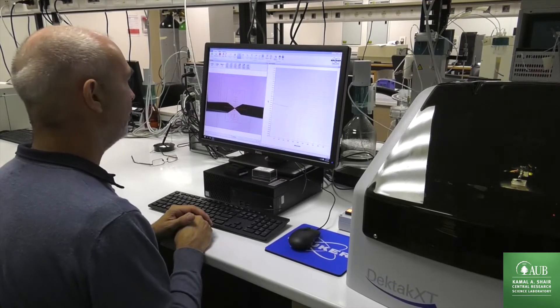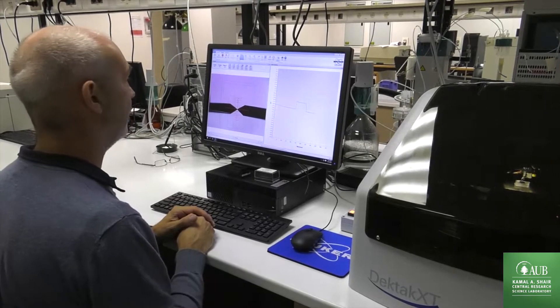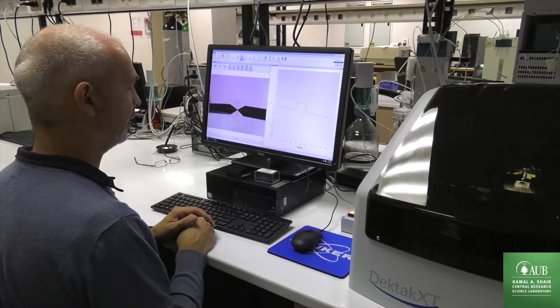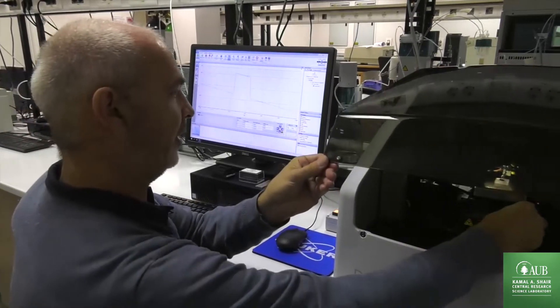it saves me from manipulating data later software-wise. So we are slow in getting there.